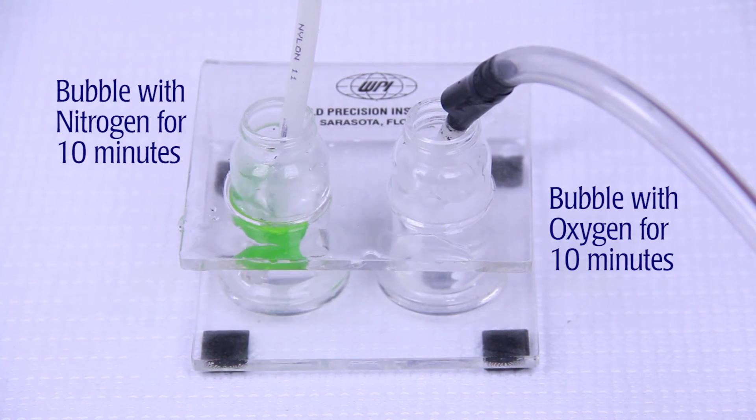To ensure that the solutions are fully saturated, bubble for at least 10 minutes.